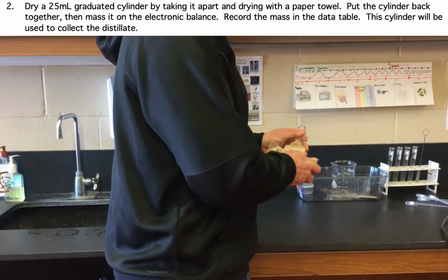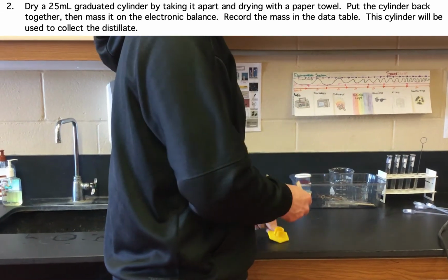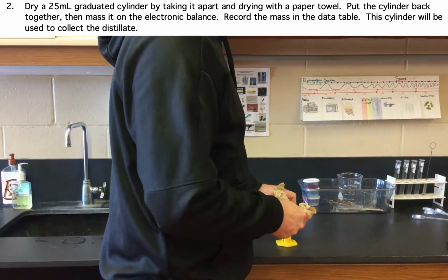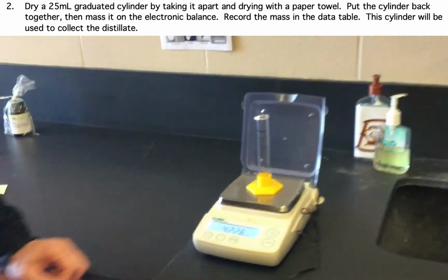Let's go ahead and start the lab by drying off a 25 milliliter graduated cylinder and getting the mass of that empty graduated cylinder. Make sure to record the mass of this empty cylinder in the data table on page 2 of the lab.